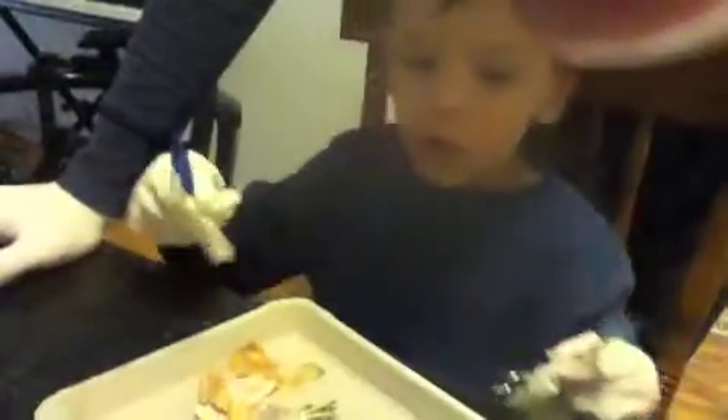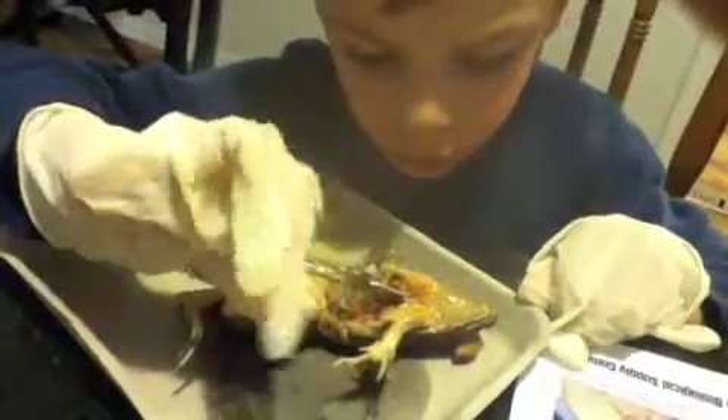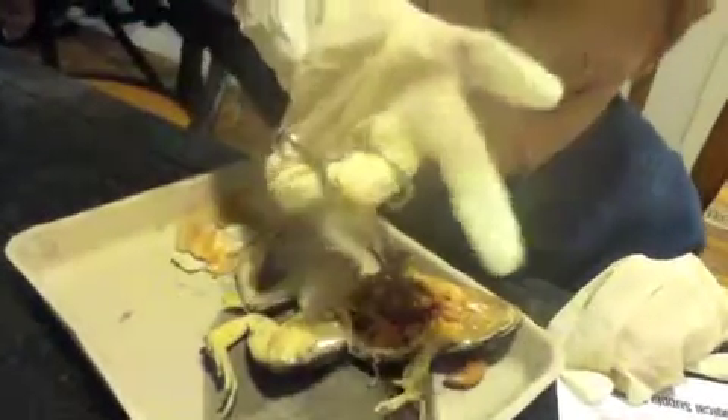What other organs are you going to get out? What's that one? That's a kidney right there. Kidney. Use forceps to lift the organs. That's the heart. Use forceps to lift the organs. You see those fatty bodies? Yes. What else is still in there? Is the pancreas still in there? Yes. The spleen? We took it out.